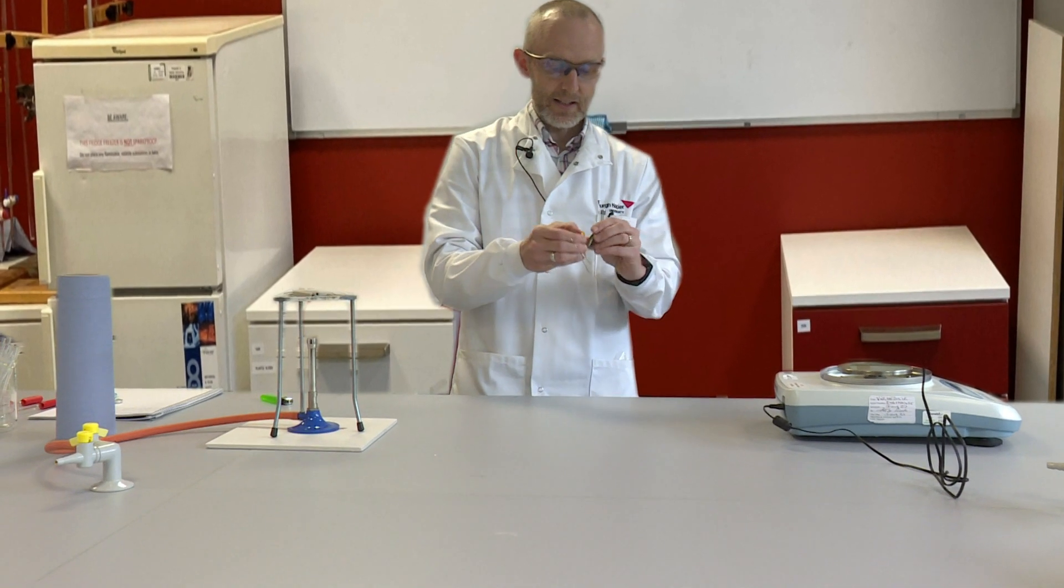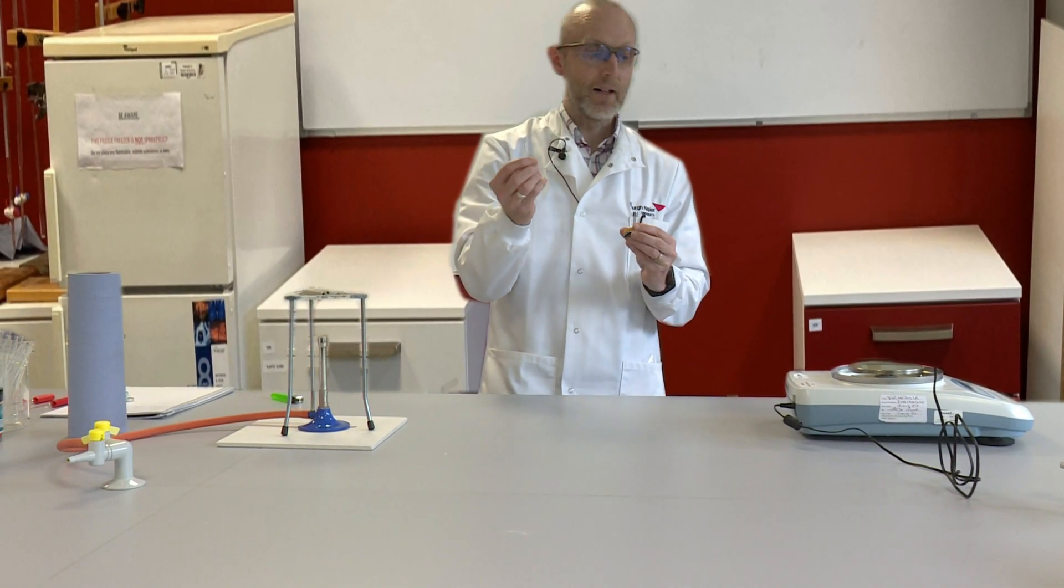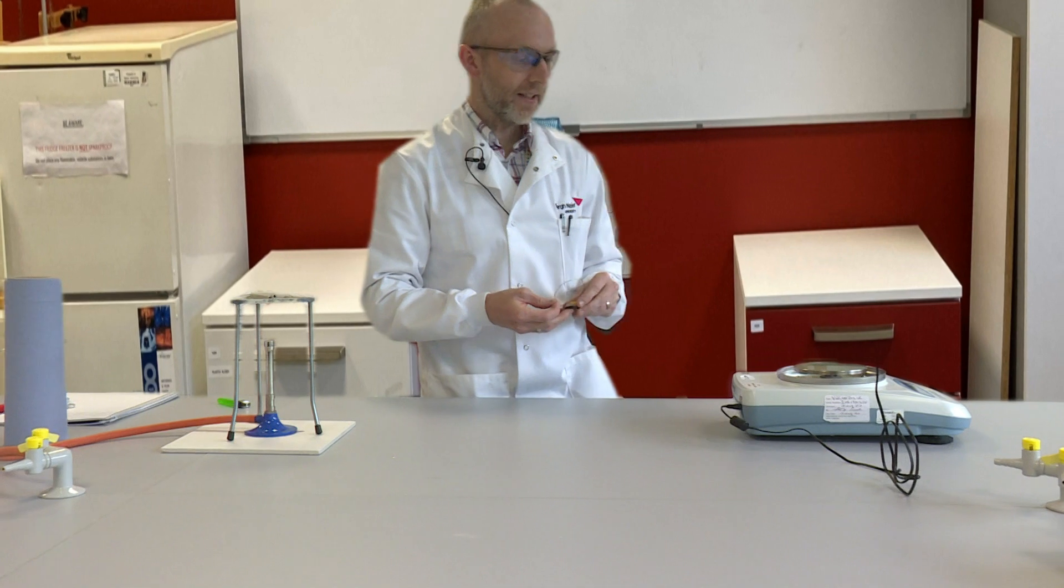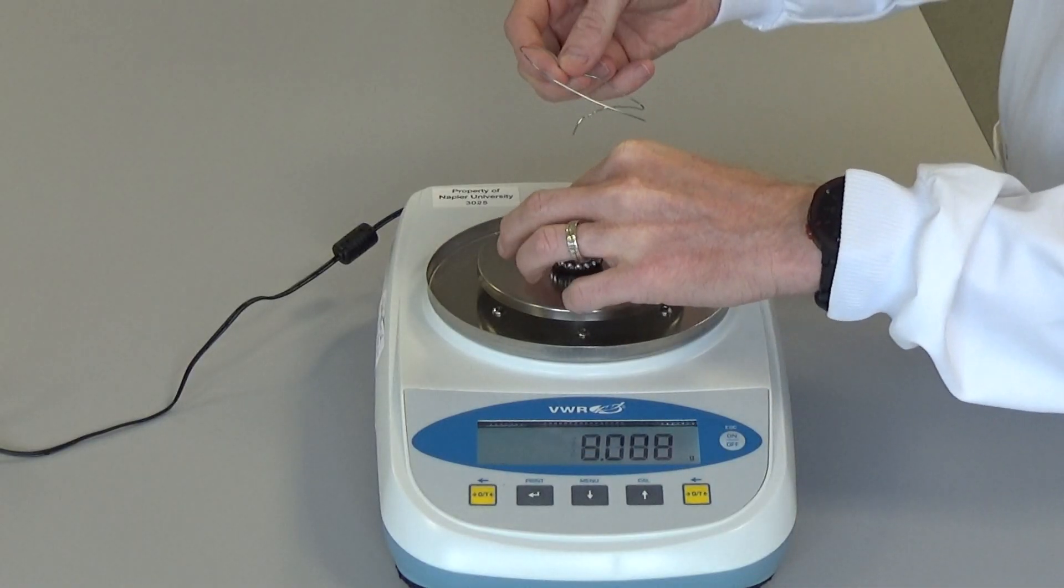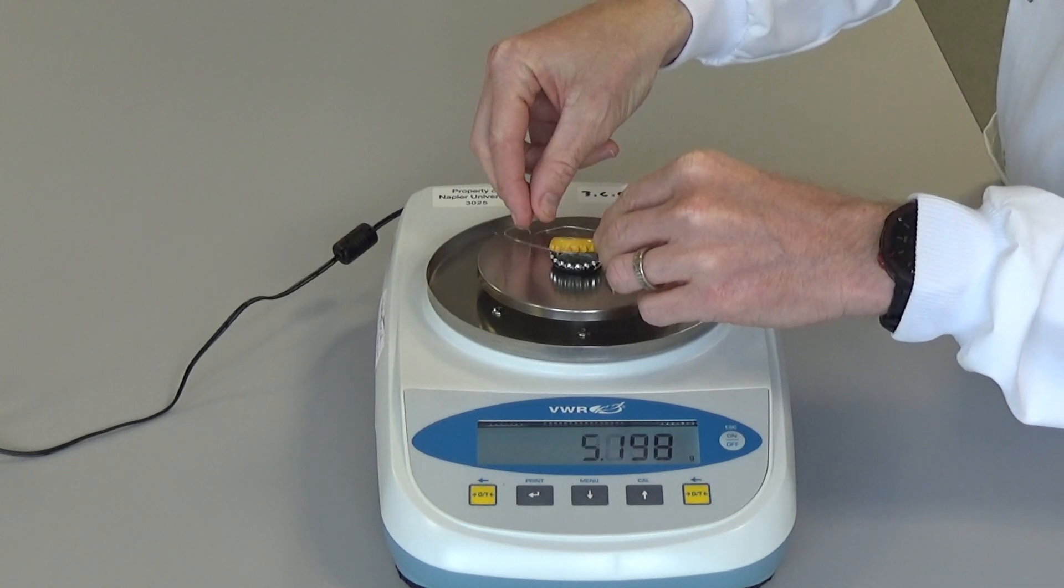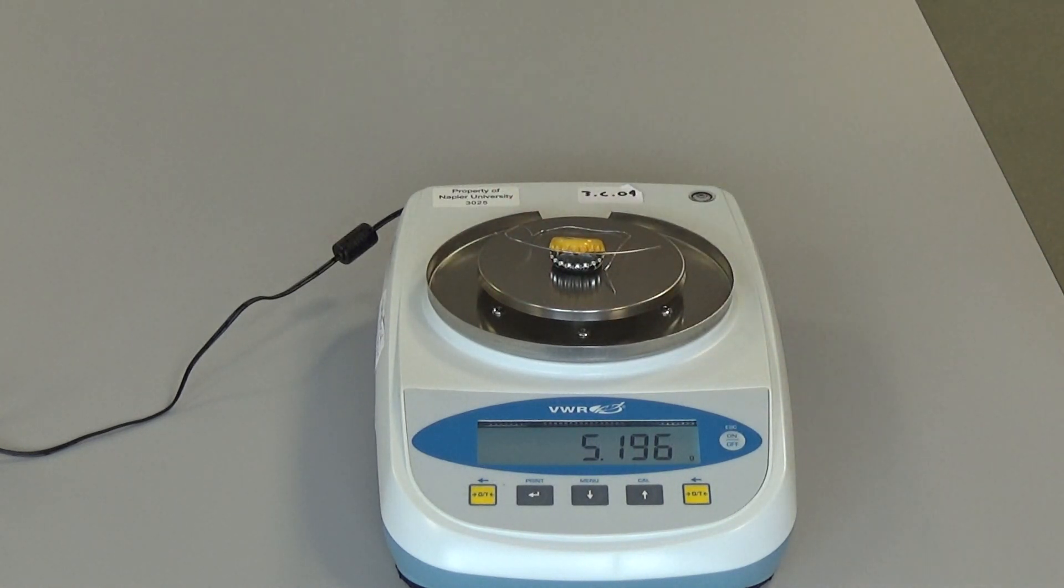I'm going to heat it inside these bottle tops held together by nichrome wire. So I'm going to take the mass of the two bottle tops I'm using and the nichrome wire, and that is 5.196 grams.